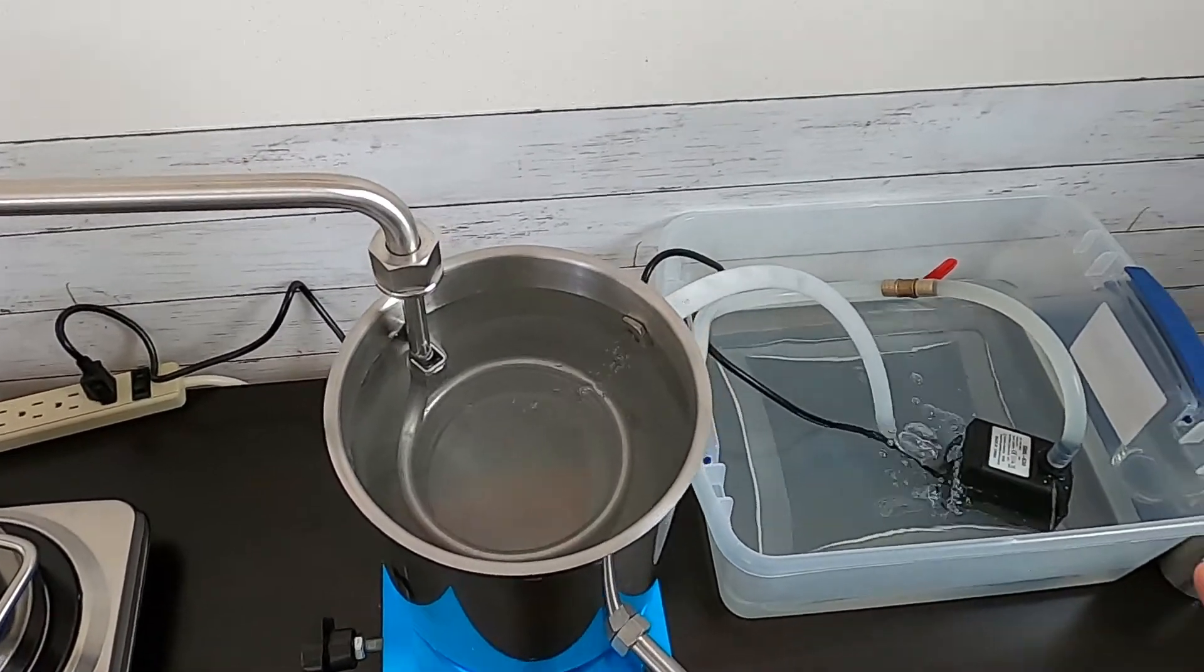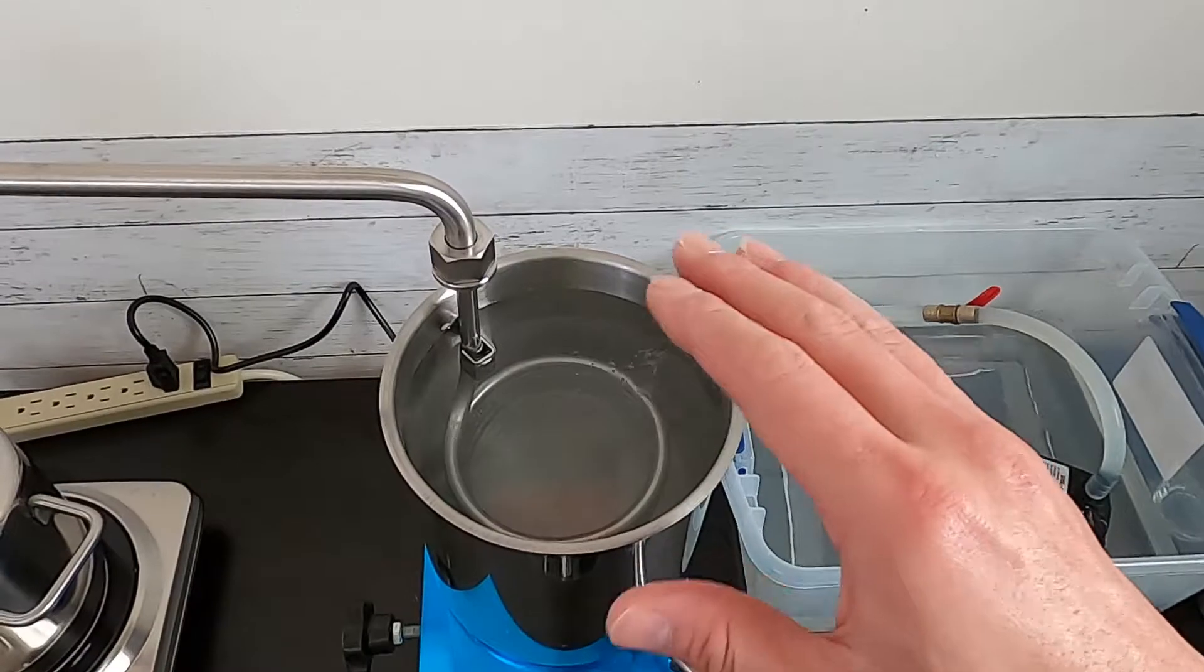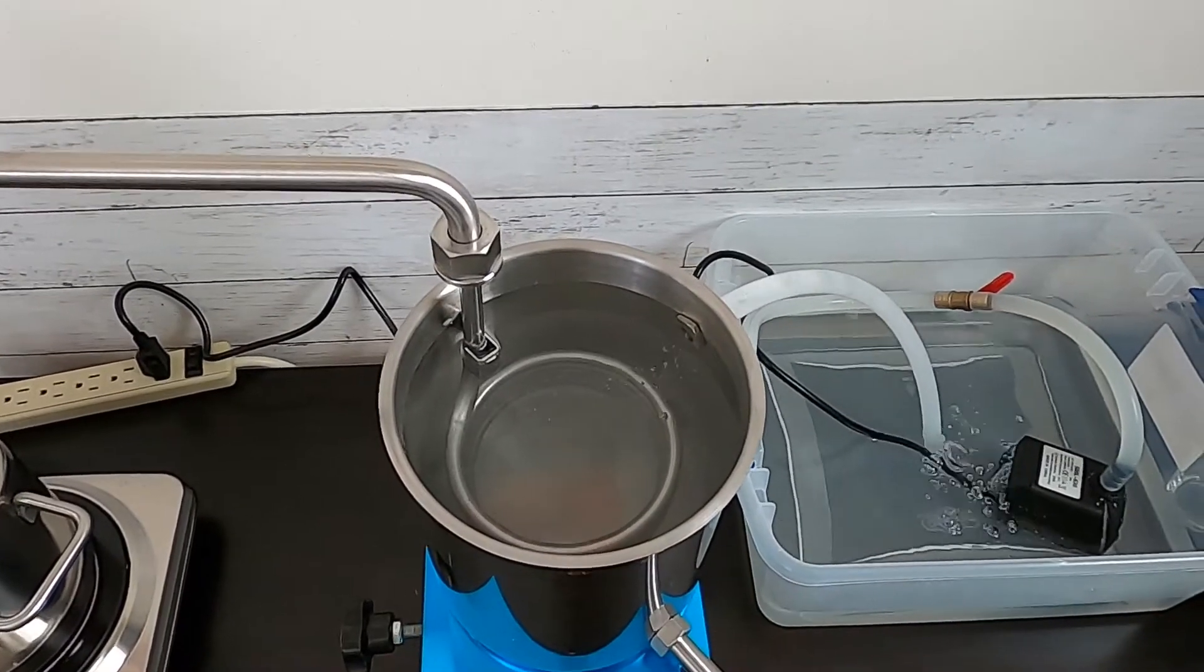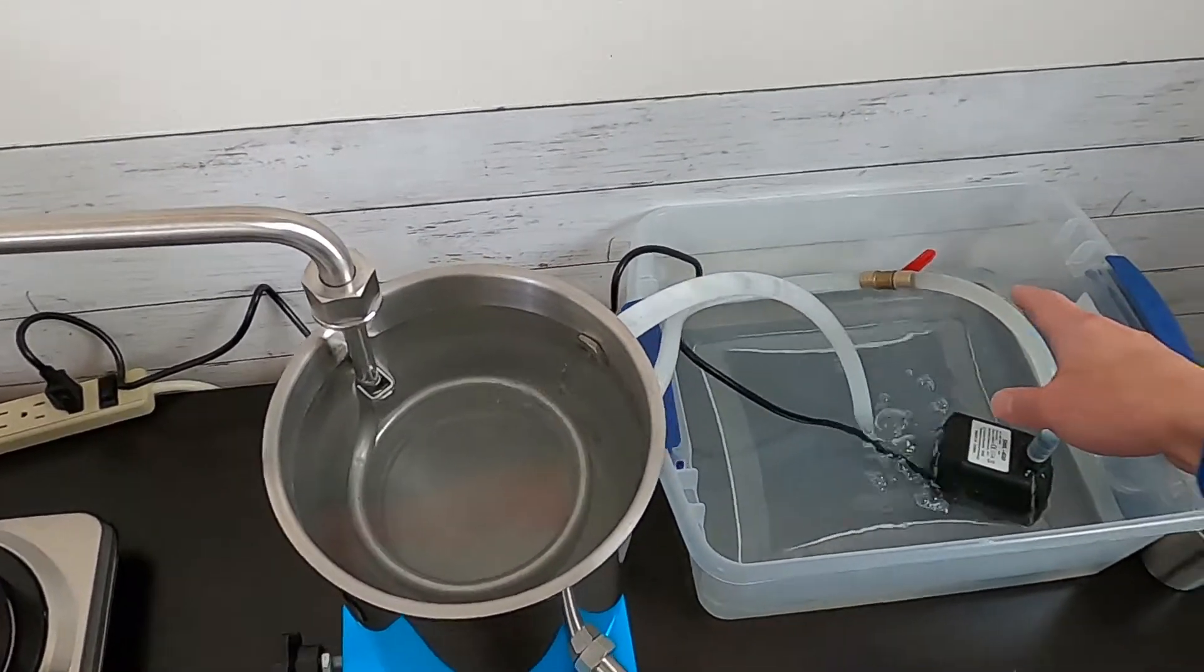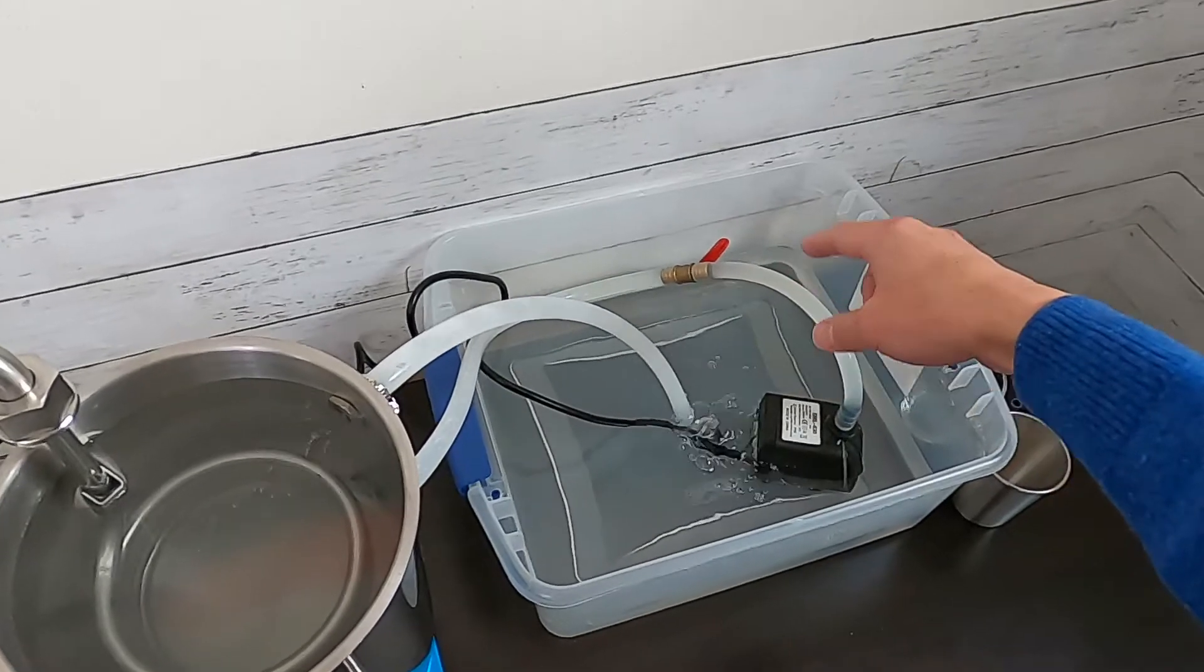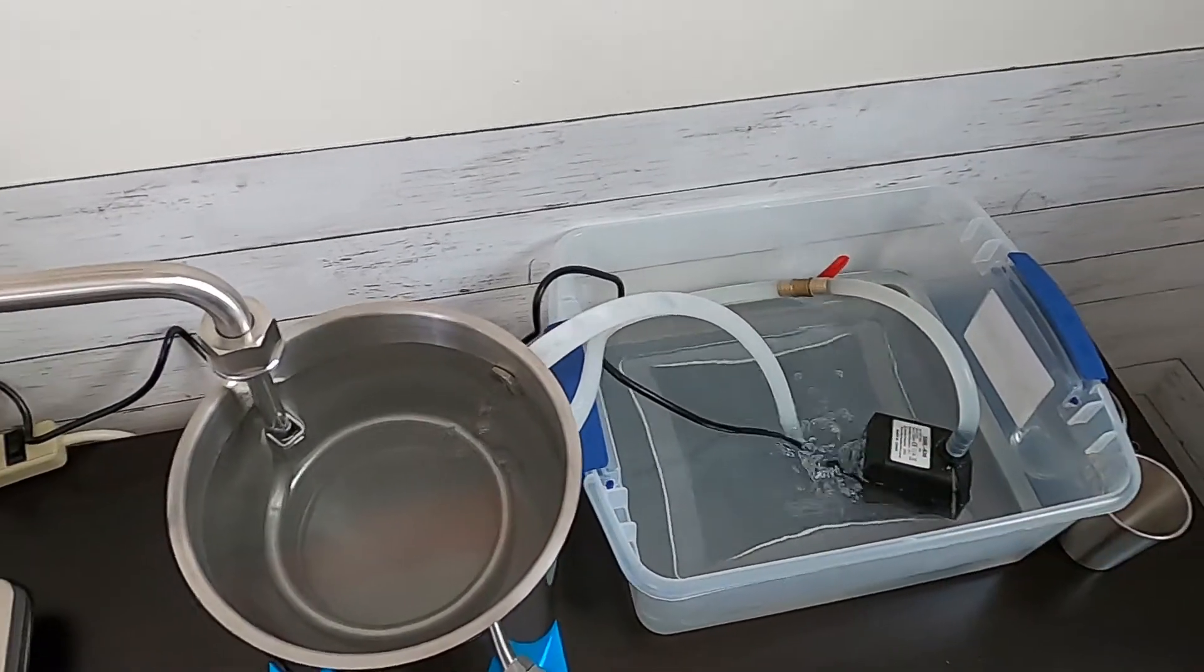Just in case you see overflowing, then you turn off the power. And then, adjust that valve before you turn on the pump.